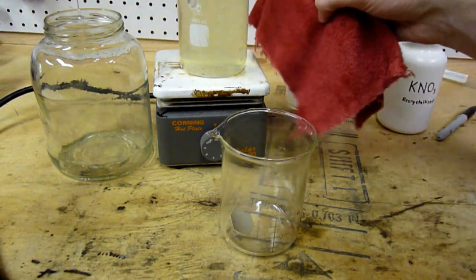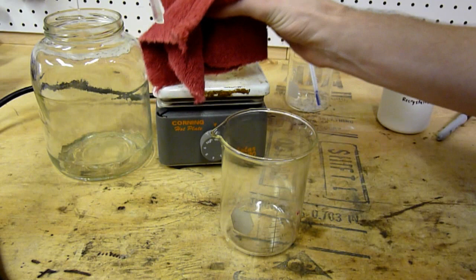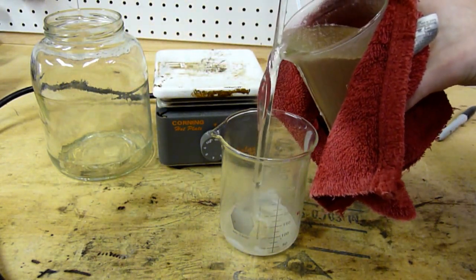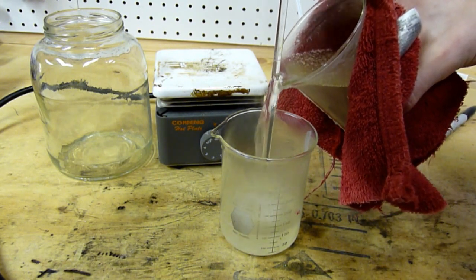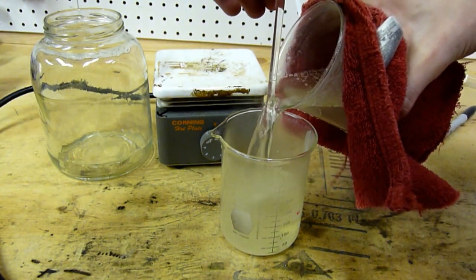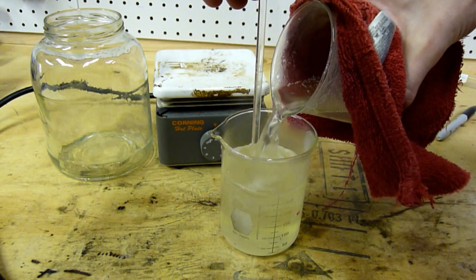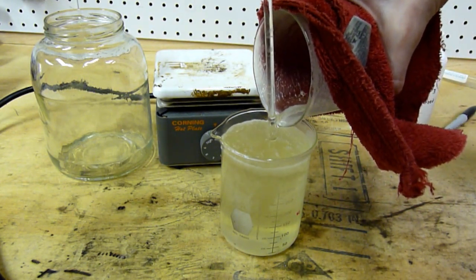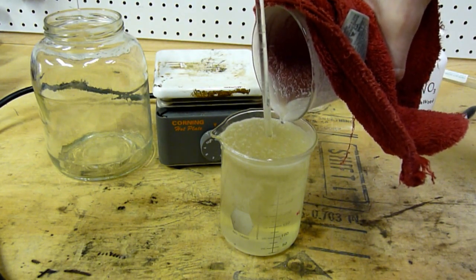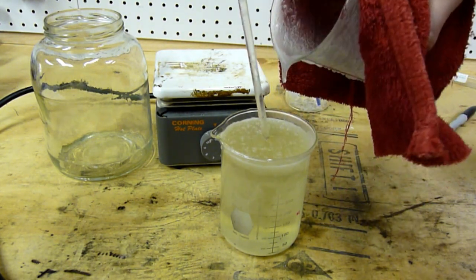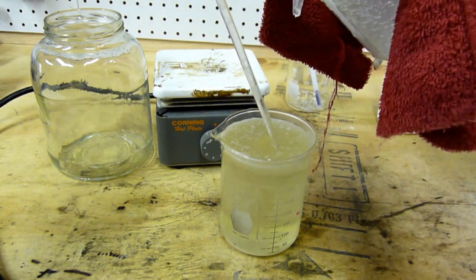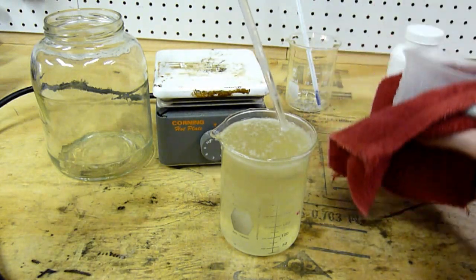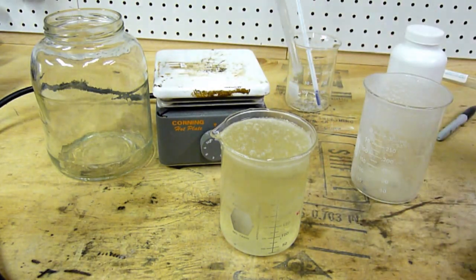Here we go. Trying to get all the gunk in the bottom as best as possible. Look, see, it's crystallizing right in front of us. As it just cooled off, it's totally falling out of solution. That's really cool.